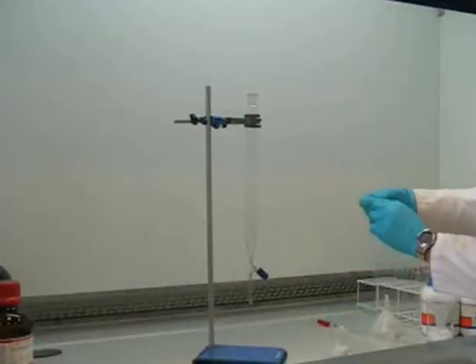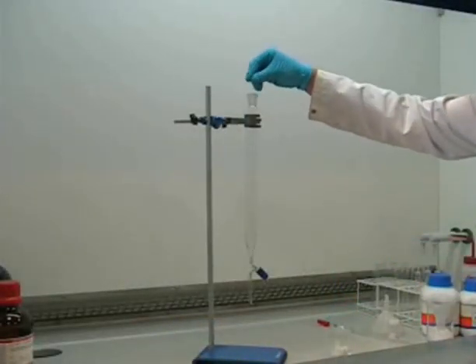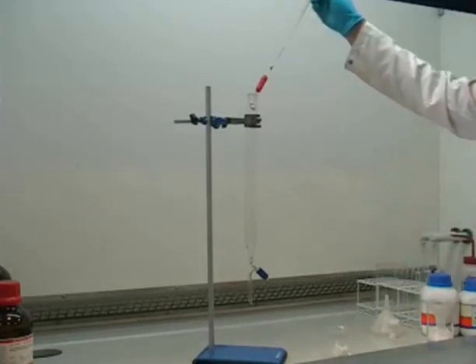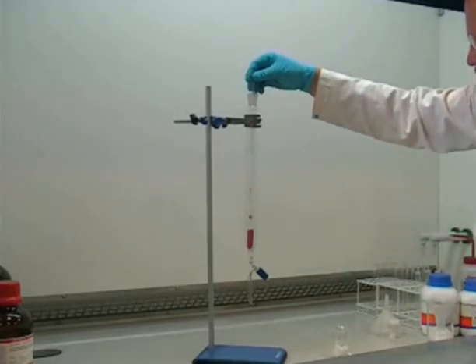First of all, a small piece of cotton wool is placed in the bottom of the column to prevent solid material from going into the tap. Different columns may have different types of tap, but obviously the idea will be the same.